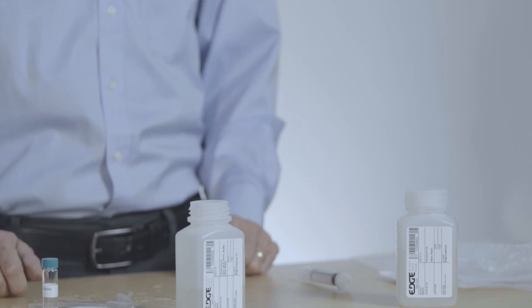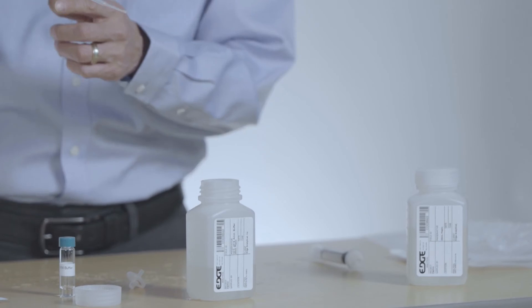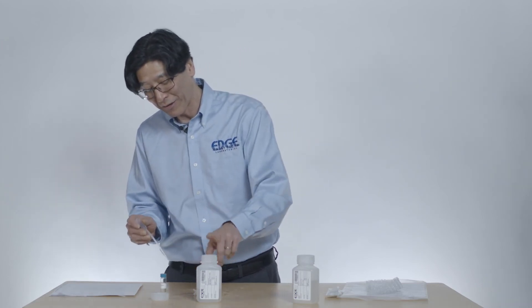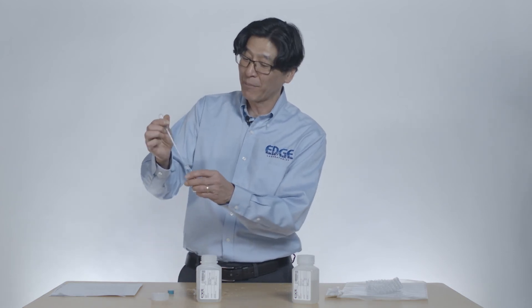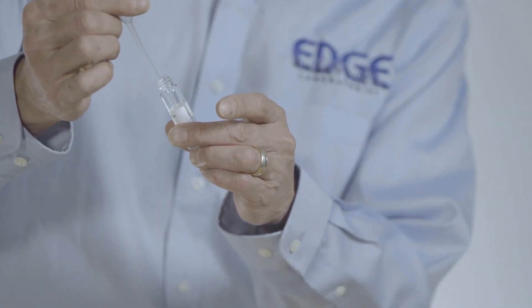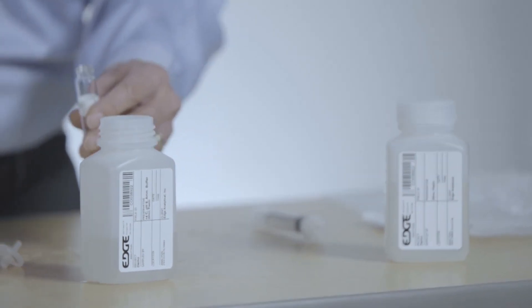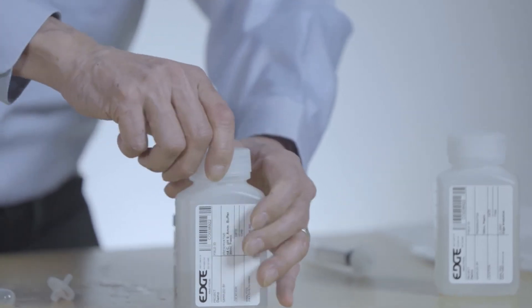Now it is time to preserve it. We have an ammonia buffer and a little pipette for transferring the preservative. There's a 1 milliliter mark right underneath the bulb. We're supposed to put 1 milliliter per 100 mils, so we need 1 milliliter in this 100 mils of sample. We're going to squeeze the pipette bulb and draw up the buffer into the pipette — it will come up to right around the mark. Then we just drop it over here, squeeze it in, and seal this up. Now we have our sample preserved, so we're going to seal this tightly.